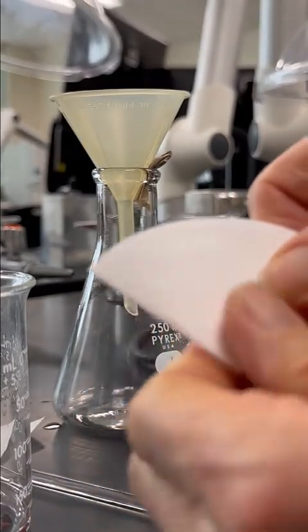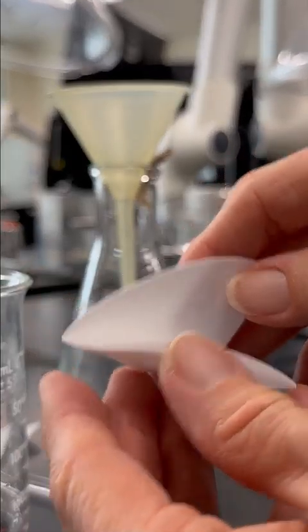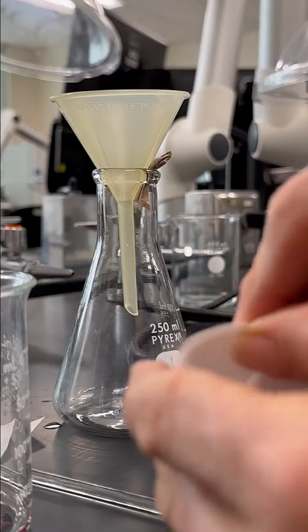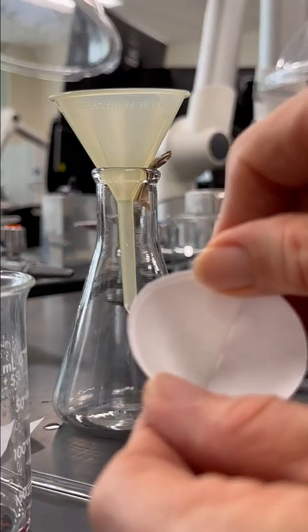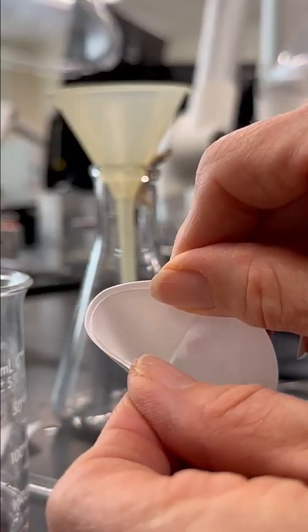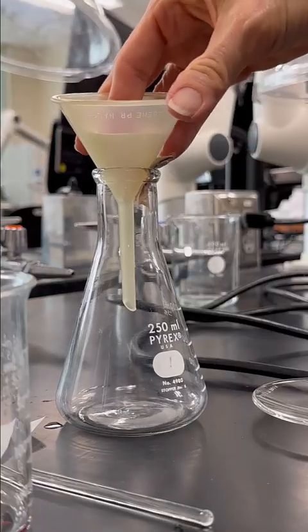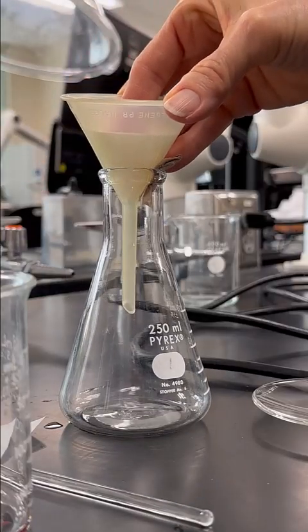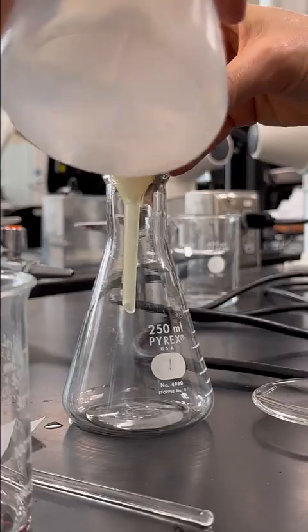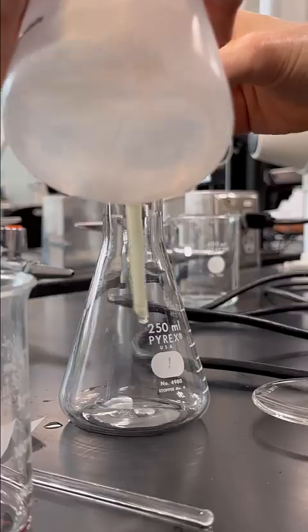All right, and then when you open it up, you can open it in half, but that's not really helpful. So I'm going to put three sides together and then one side here, and you can see I made just a little basket that I can use to catch my sample. So I'm going to set that up in the filter. It doesn't really like to stay, so I'm going to wet the filter paper down just a little bit to make it stick in there. And this is just water.